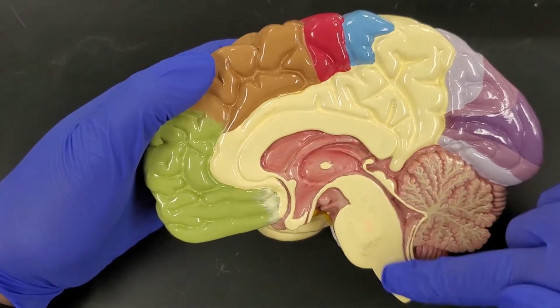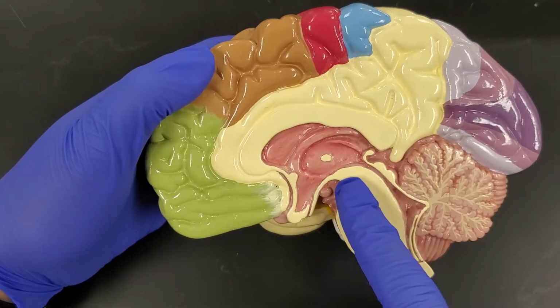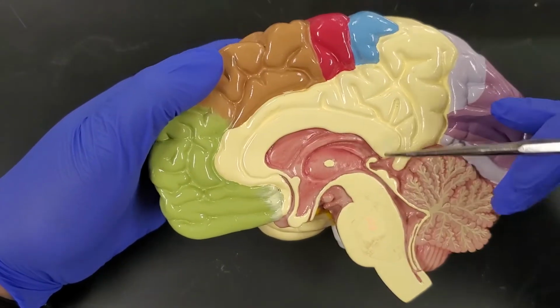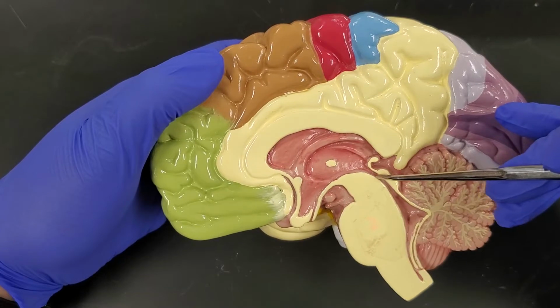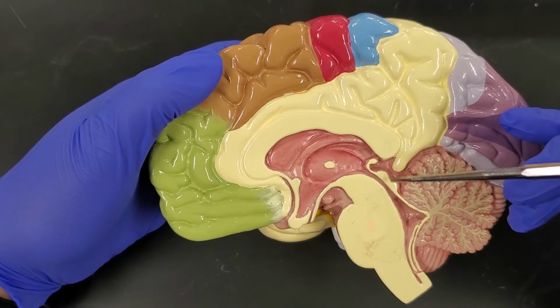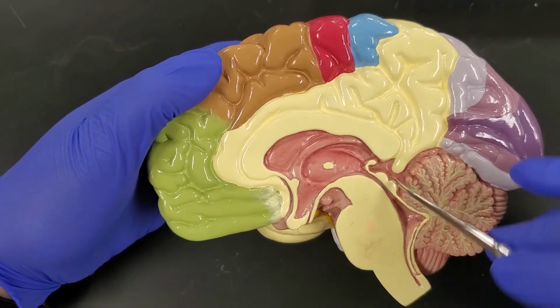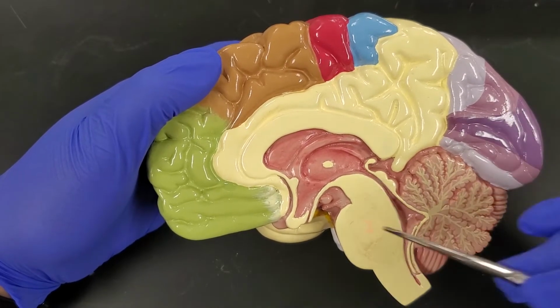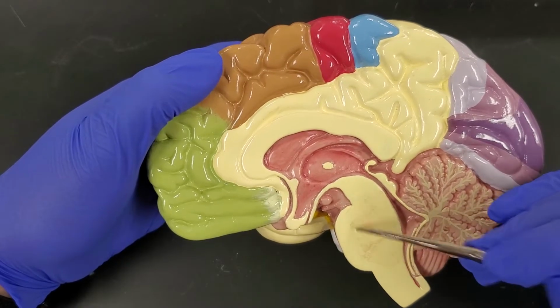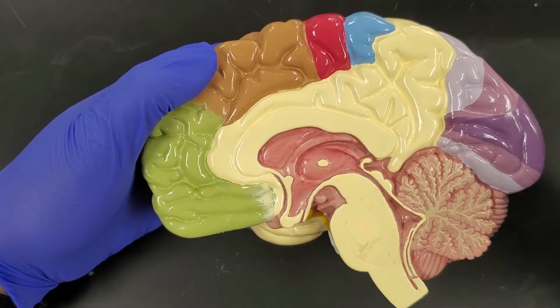And then when we get into the brainstem, we have the midbrain here. We have the cerebral aqueduct, which is basically this structure here. We have what's known as the corpora quadrigemina. There's 4 protrusions, 2 on either side, so we see 2 of them here. We see the pineal gland, which is going to be here. And then we get into the pons, the medulla oblongata, and then that's going to go into the spinal cord itself.